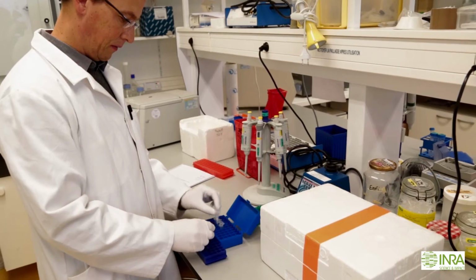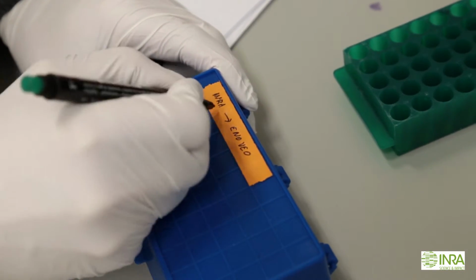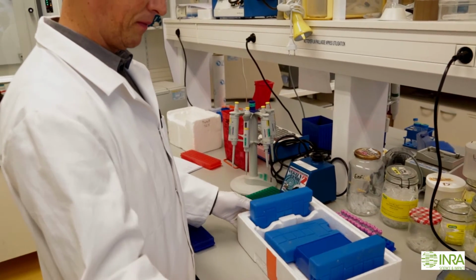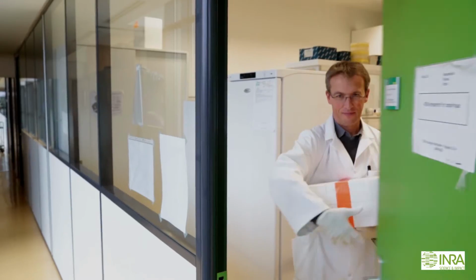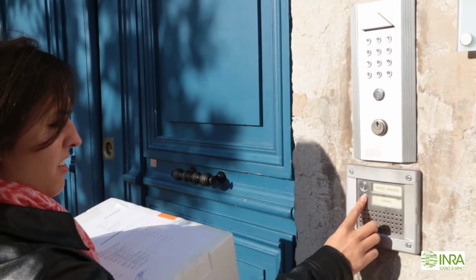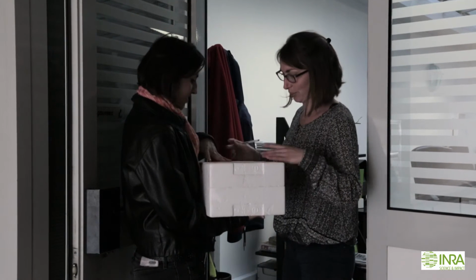Soil DNA extracted by the INRA team of Dijon is then packaged and sent to the NOVO team for further molecular analysis to estimate the ecotoxicological impact of pesticides on the abundance, structure and diversity of soil microorganisms that are supporting soil ecosystemic services.